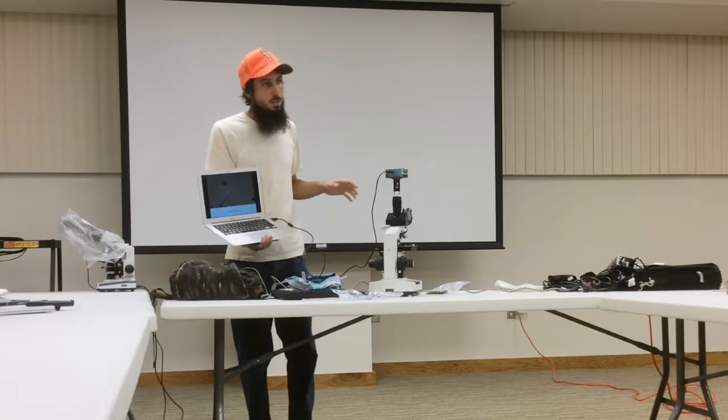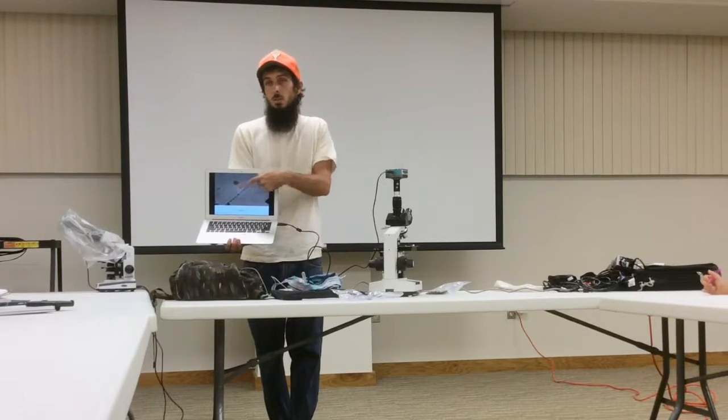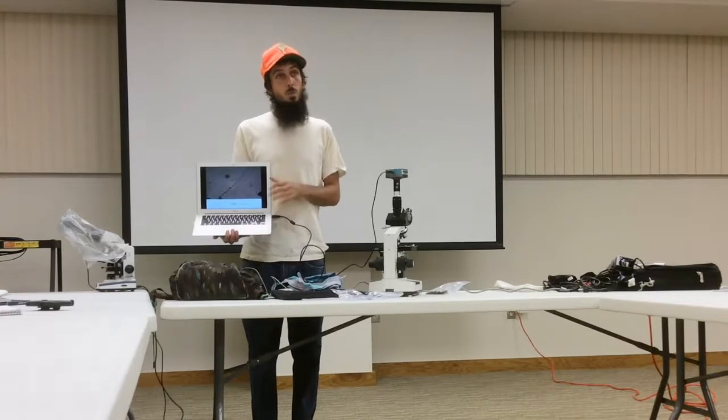A few other things you may see in the soil samples are things that are budded in a row like this. These are yeasts, which bud, and they're anaerobic fungus, so they're living without oxygen. That's what makes beers and wines. So that's not a good thing to see, it depends, not in large quantities. If you're making a compost tea and you see a lot of yeast, you know you've lost oxygen and you're probably not growing what you want.